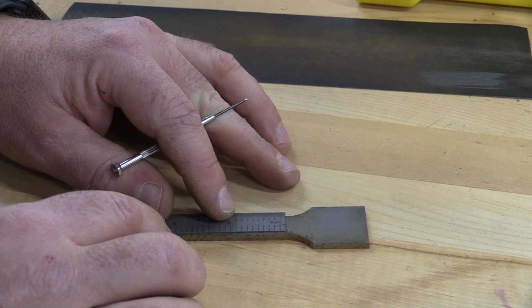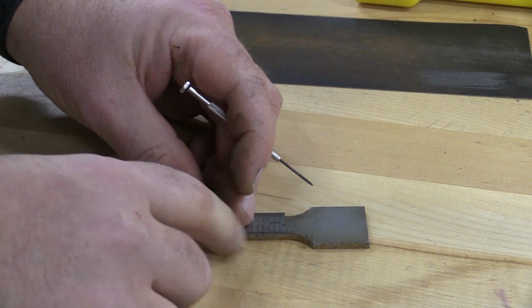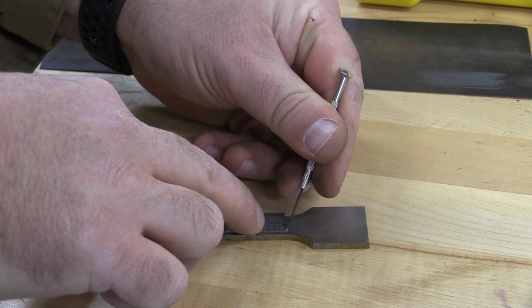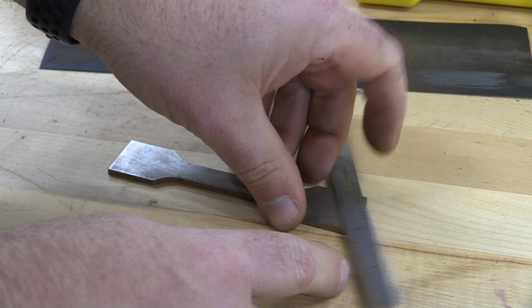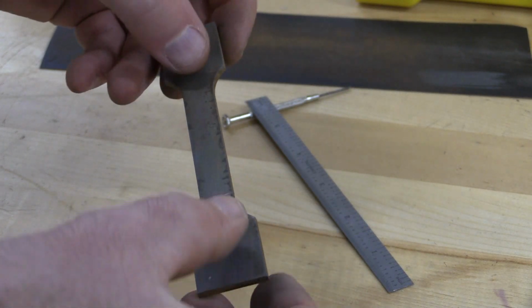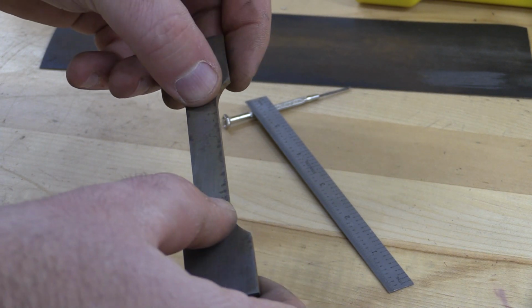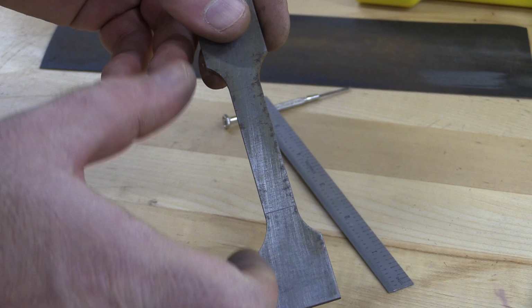So I'm going to get it lined up with this 4, and I know up here is the other 2, and I am running pretty parallel, and I'm going to lay out another line, and that's going to be my 2-inch gauge length. So at this point, if I get this right, I have 2 lines which represent my 2-inch gauge length. I'm going to be using those after I pull the sample to calculate my percent elongation.